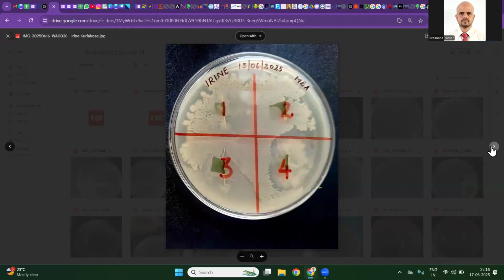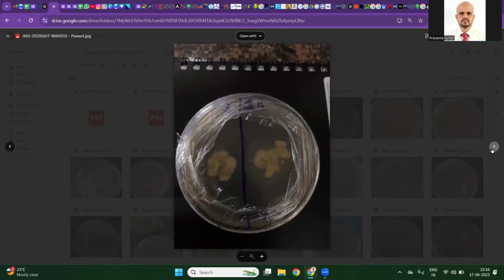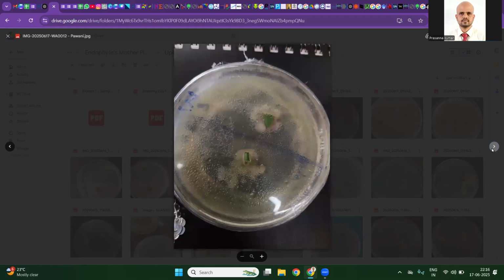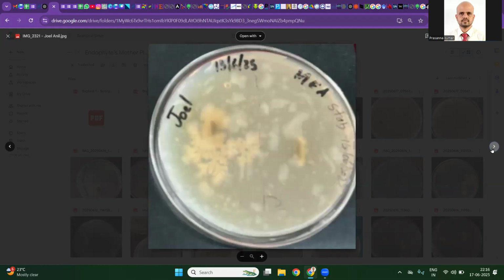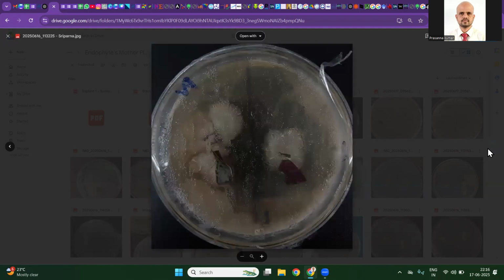This is swarming everywhere. I hope that this imprint is also not clean. Avoid the photo shadows here. You can see the shadow here. So remove the wrapper and take the picture for better interpretation. Water droplets should be removed. Need more focus. Contamination everywhere. Swarming everywhere. Water droplets have fallen in and they have started swarming.